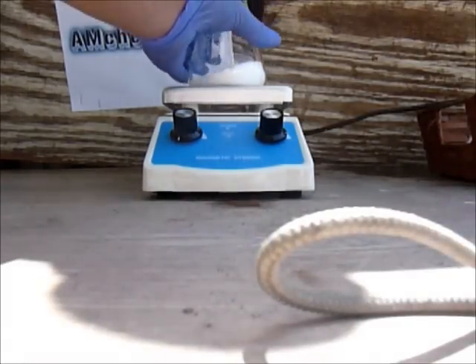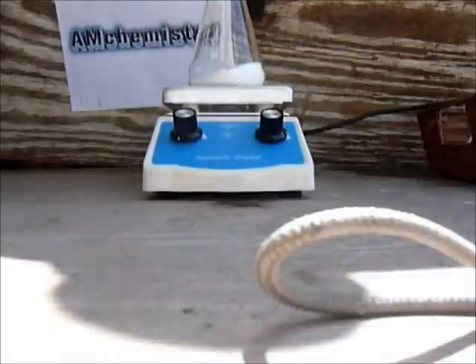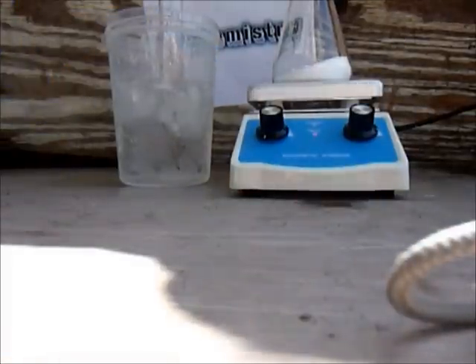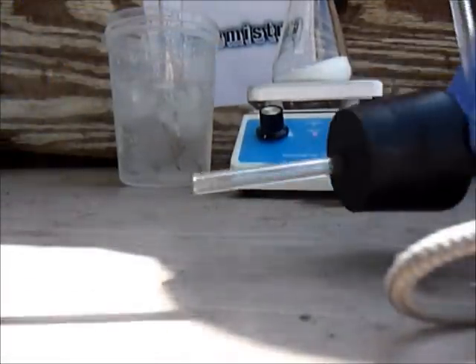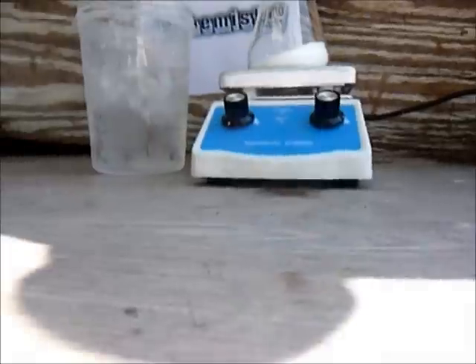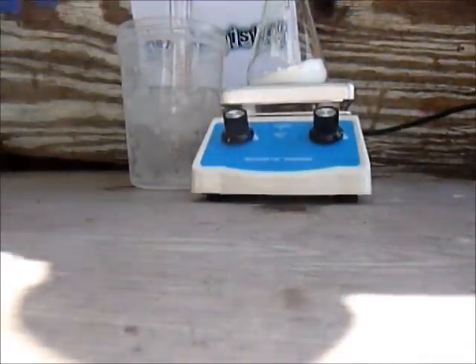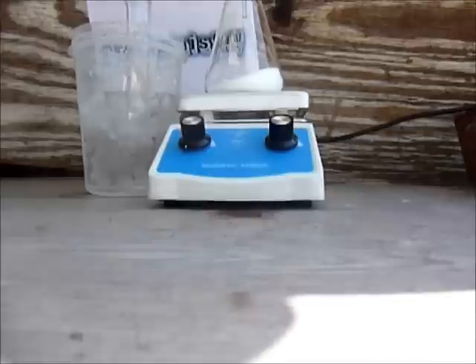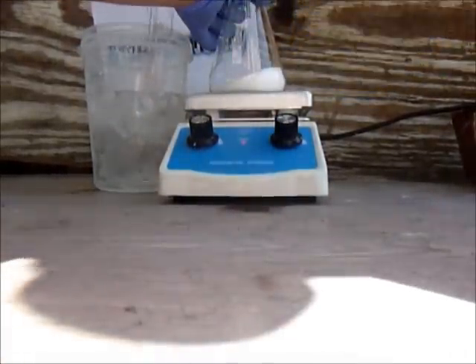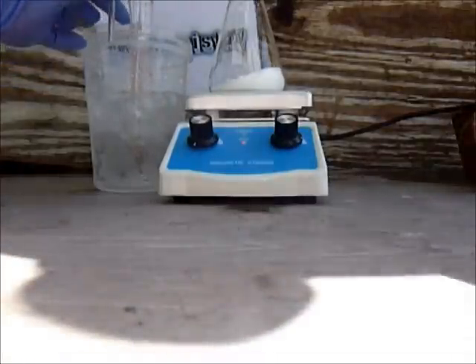Just leave it like this and get 25 milliliters of ice-cooled water as seen right here. You will also be needing something that looks like this. Get it and make it go like this. To lower the temperature, add some water in this vessel that will generate hydrogen chloride gas — just wet it on top.